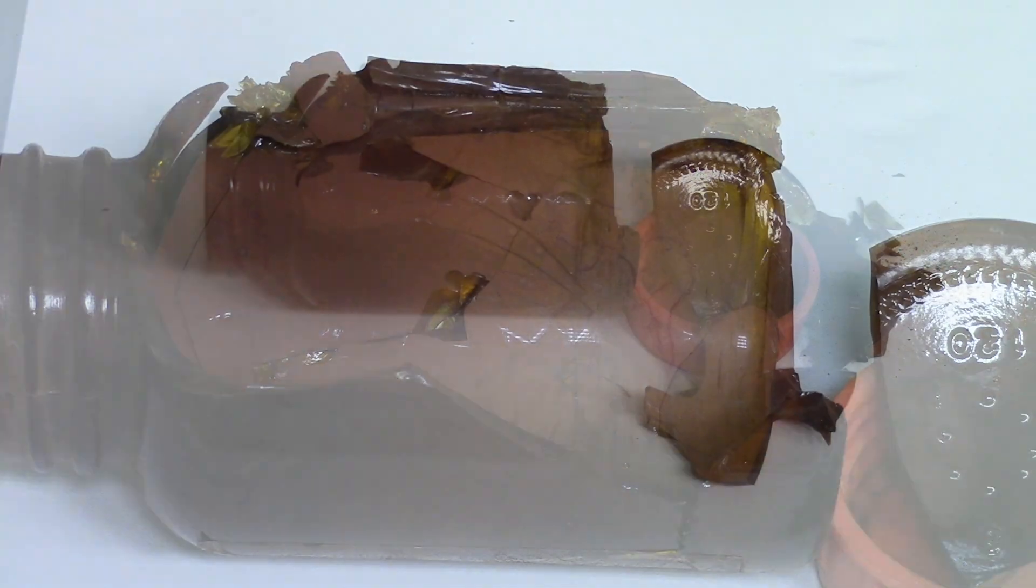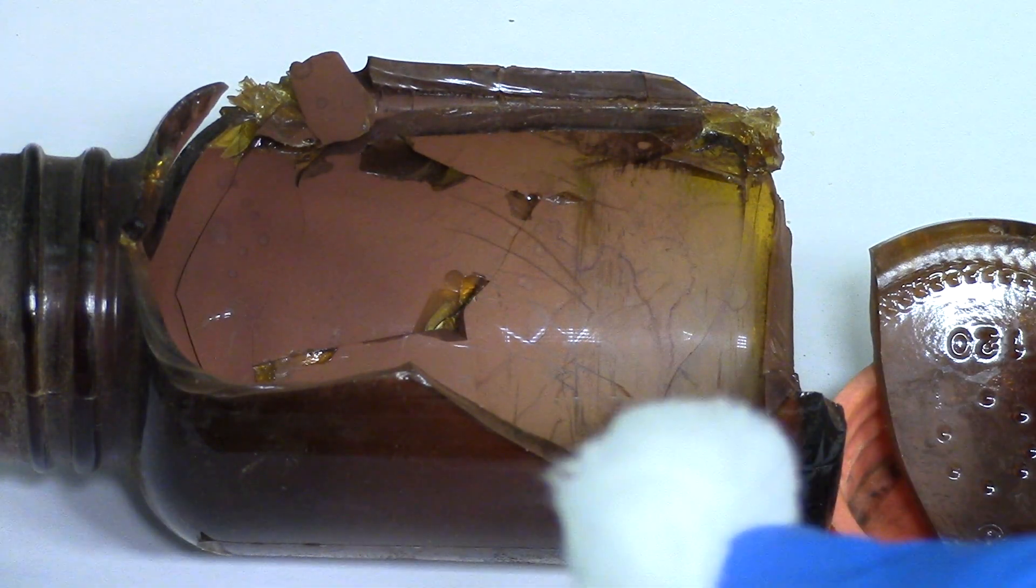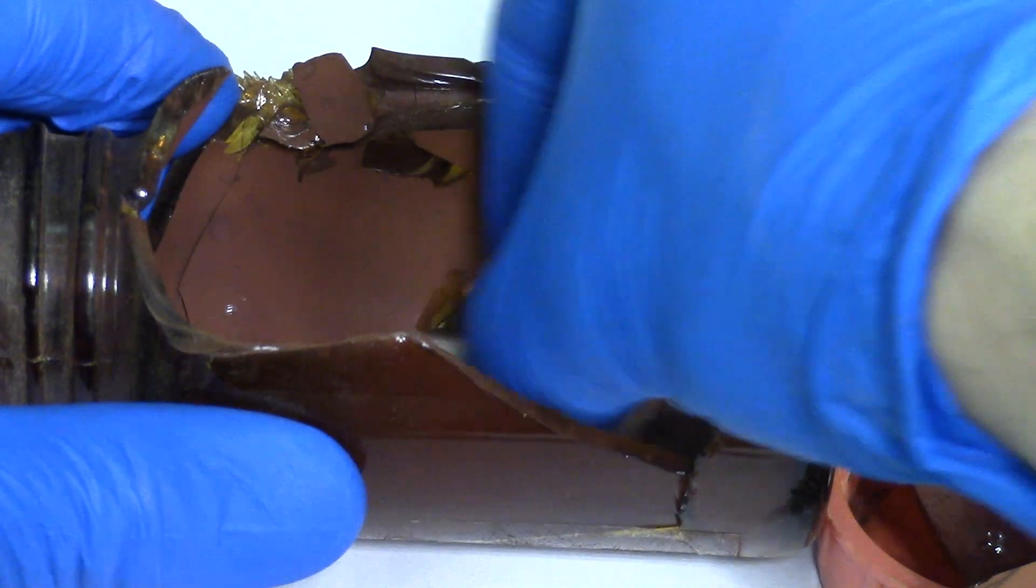Salute my dear chemists! Welcome to Akansarok's channel and today I'm going to show you how to recycle palladium waste through the example of palladium dichloride.